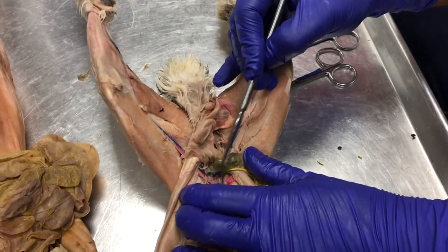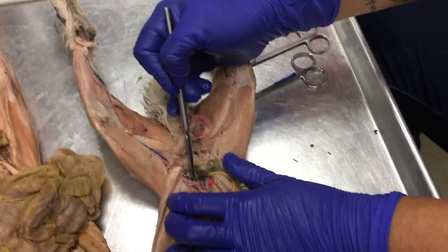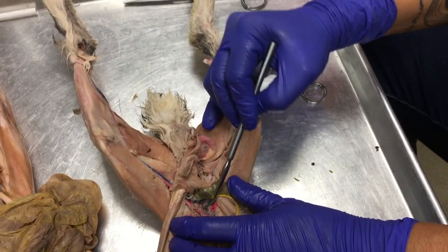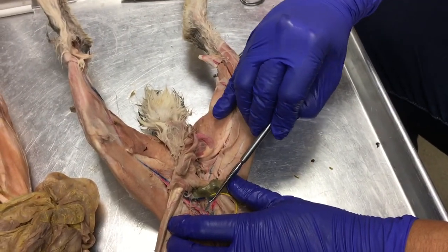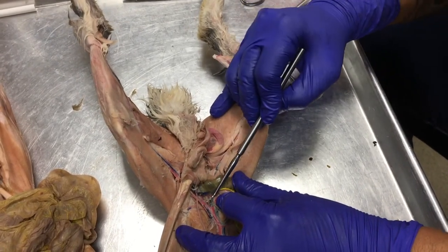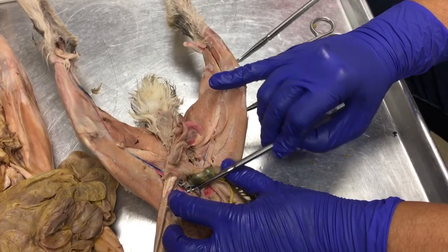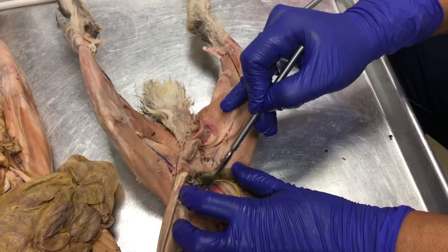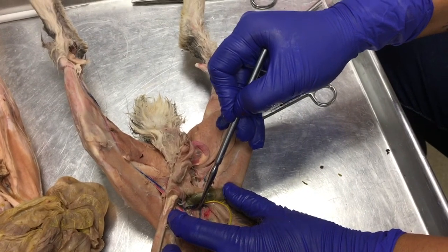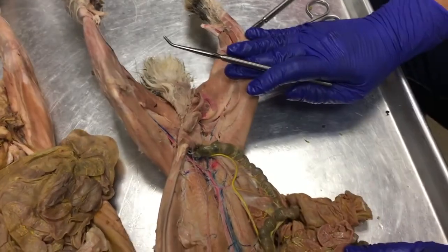Our V here of external iliac arteries, another tributary runs medially. It's a small tributary on this side here. Looks like, there we go. So I have my two internal iliac arteries, and then straight down the center, see this pink thing right here, straight down the center is the caudal artery bringing blood to the tail. Okay, so that's what we have in the posterior region.